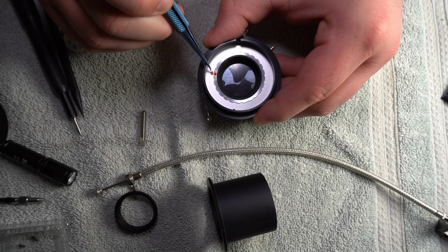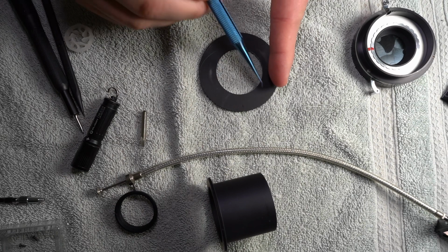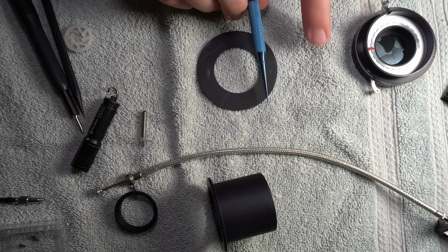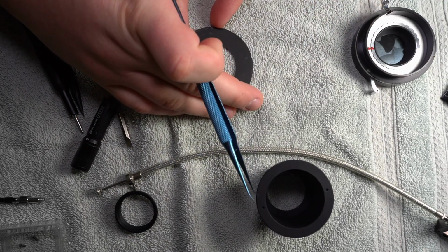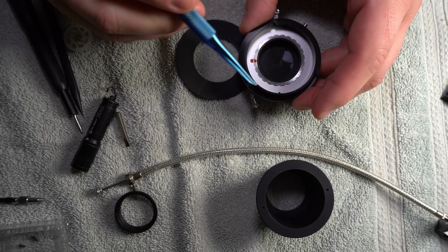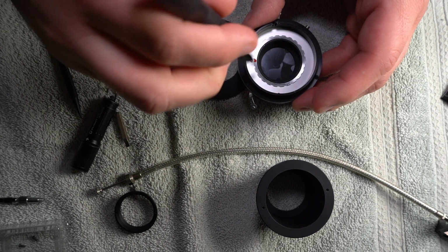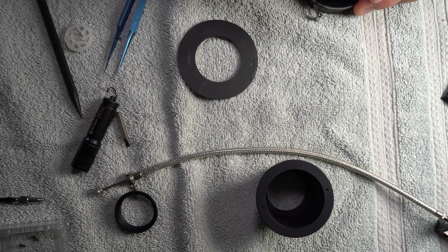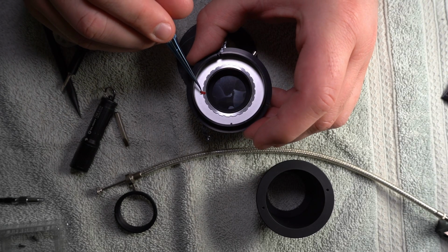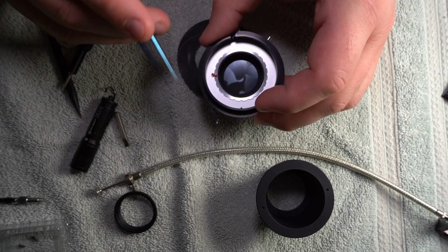That's why. And then what they did is they figured out, okay, it's got to be this tight. They've got a screw here, and the head of the screw is very, very odd. They have ground a corner or an edge off of it. So there's a straight edge here, and it's not round all the way around. That allows you to twist that side out of the way, or into the way actually, so that this ring can move. When you turn that screw, which is right here, 180 degrees from where that flat spot is, the flat spot allows this ring to move.